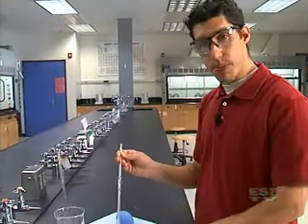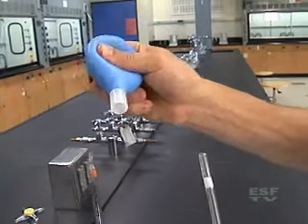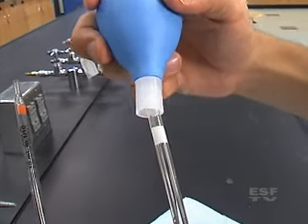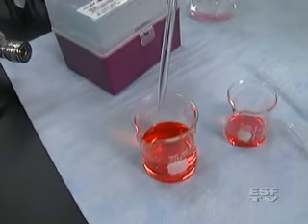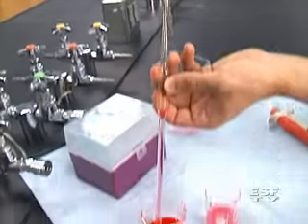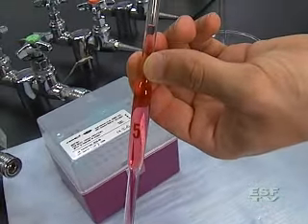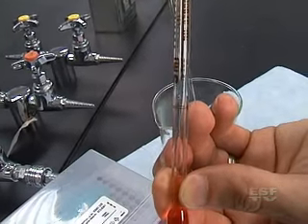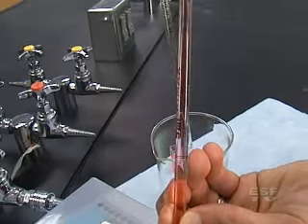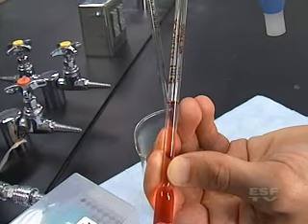To use this pipette you can use the pipette pump or a pipette bulb, which is what I'm going to use. The pipette bulb looks much like a turkey baster bulb and just has a hole in the top to put the pipette in. I'm going to rest that on the top, then go over to my solution, press down on the pipette bulb, and withdraw some solution. As I begin to withdraw I'll get near or slightly above the mark. Then if you take off the bulb quickly you can put your finger on the top and slowly let some solution drain out until I have exactly five milliliters.